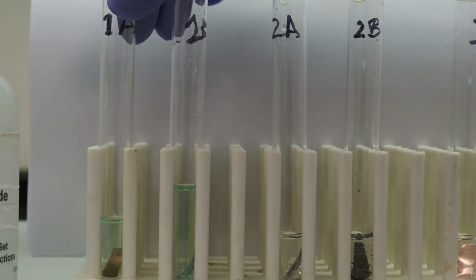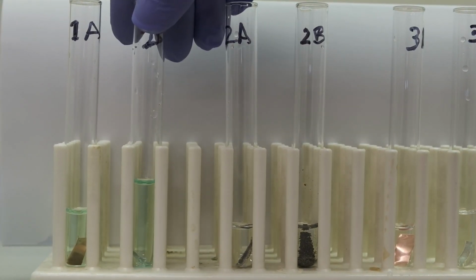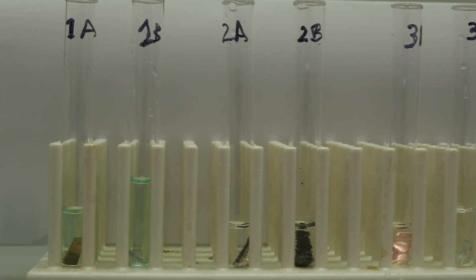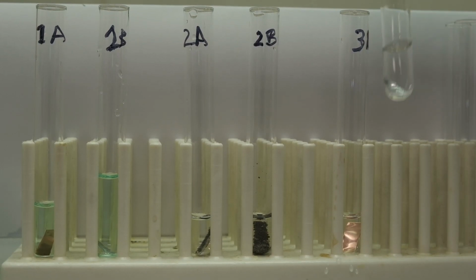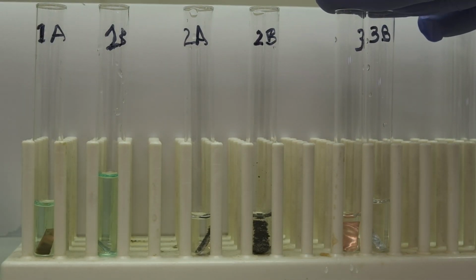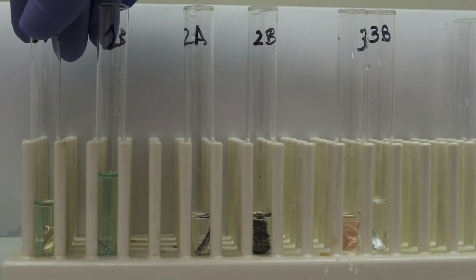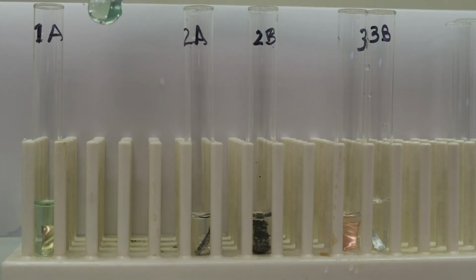To help ourselves understand what is happening in solution, first we let it sit, but we also use the activity series that is in Appendix B to see what we should expect, if we can have a hydrogen displacement or if we can have a metal displacement in the two reactions. Let's wait 10 minutes and let's see if we see any change.